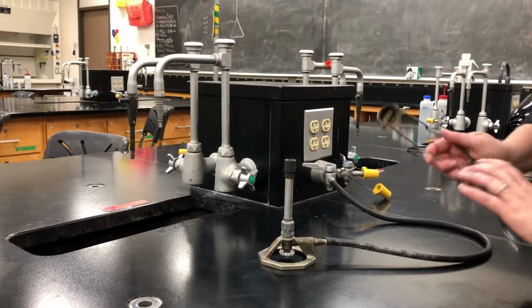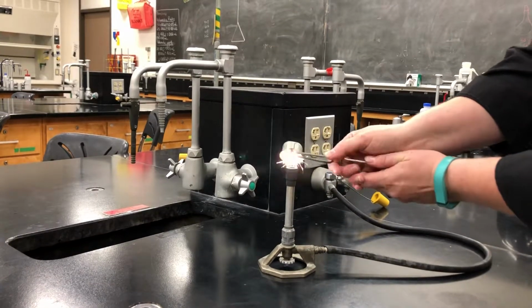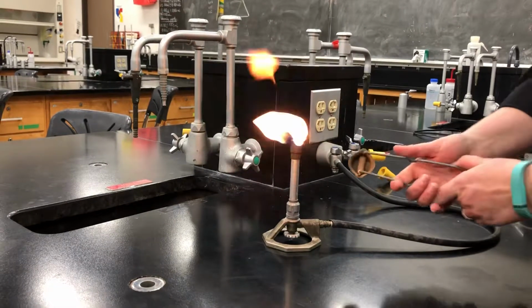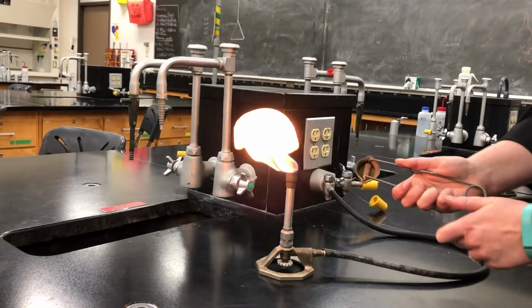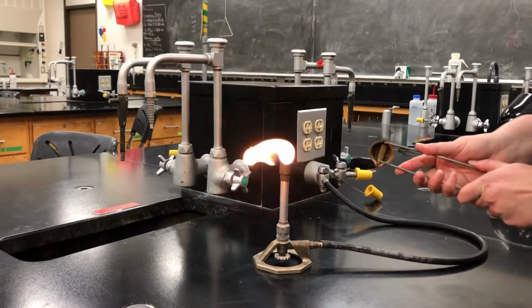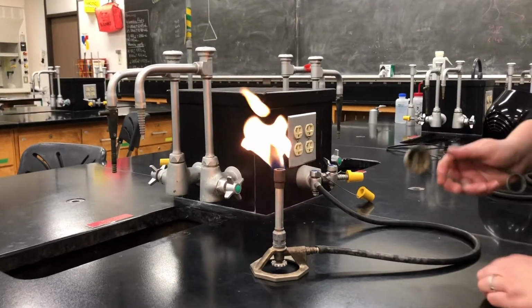So I'm going to turn it on and then I'm going to use my striker. And I'm going to hit my striker right above the Bunsen burner to turn it on. When you use the striker, you want to push down and across to create some friction on that flint to make a spark. If you're pushing up and across, it's not creating enough friction to get that spark that you need.